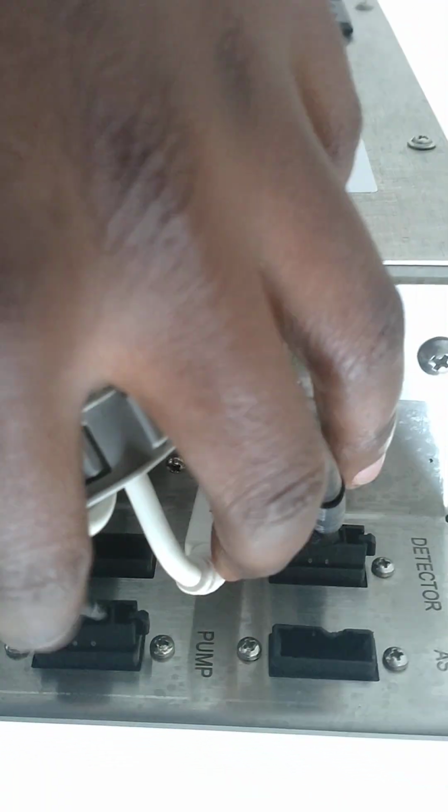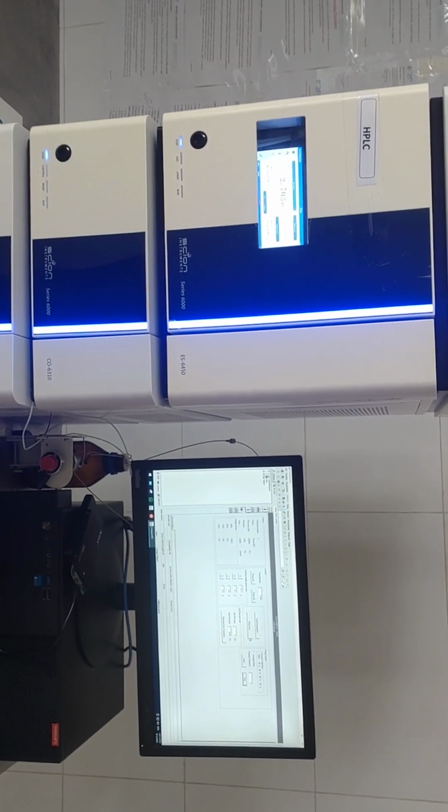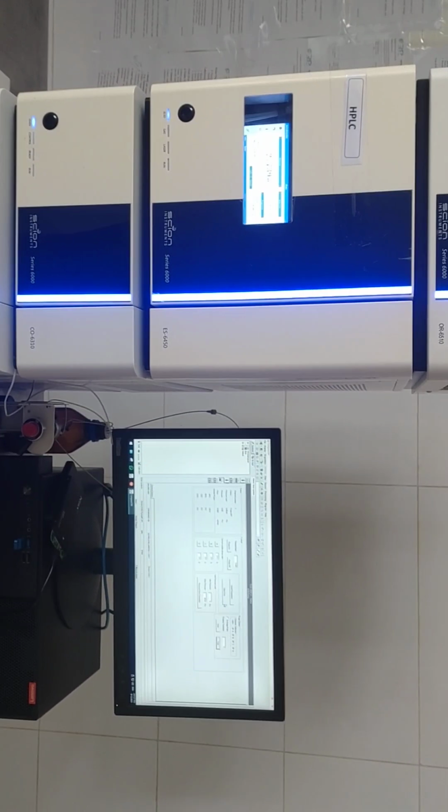This is it from the pump also. Then this one also goes to the organizer. You can see this is the one that also goes to the pump. This is the one, PU03, goes straight to the organizer. And the other detector is not working, but we are trying our best to see whether it can work. See you, and we shall give you other components together with this report. Thanks.